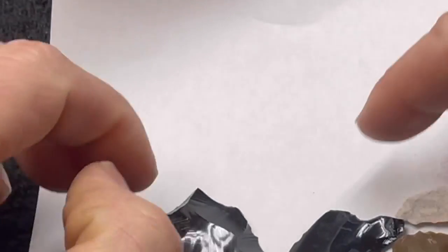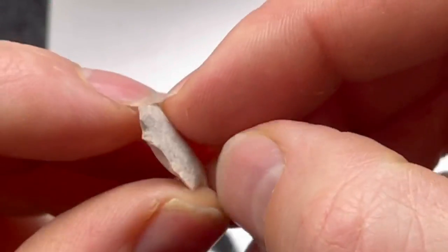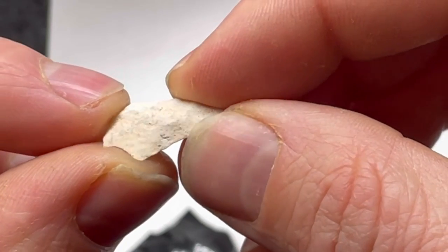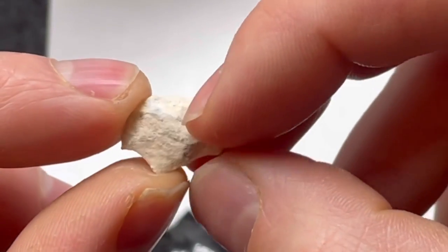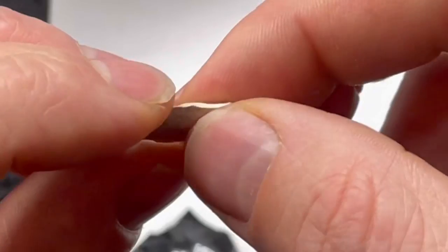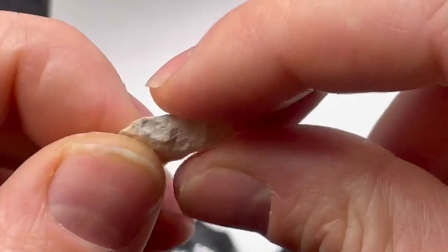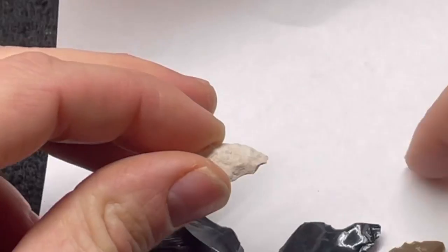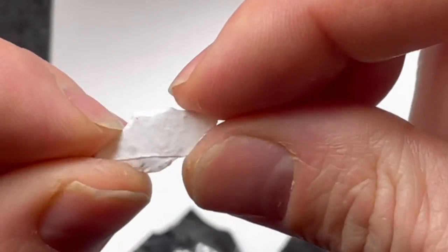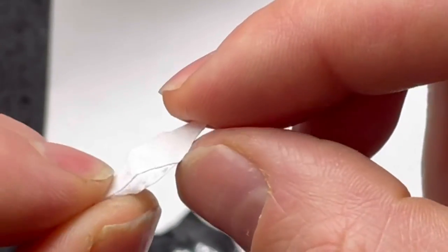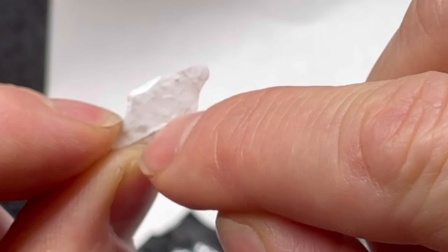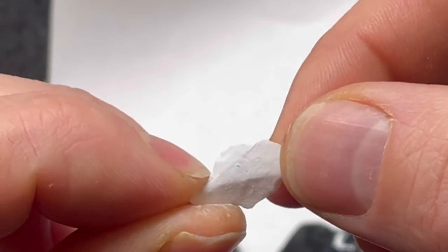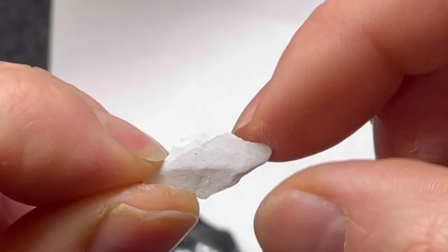So anyway the flint piece, you can see it doesn't really have those. It dissolves more smoothly I guess. It's more like it just shrunk down. The other chalcedony, it seems to have had some like veins going through it. See there places where it was more difficult to dissolve.